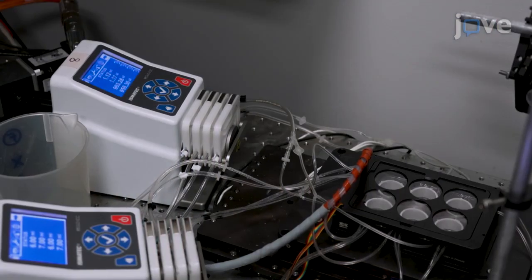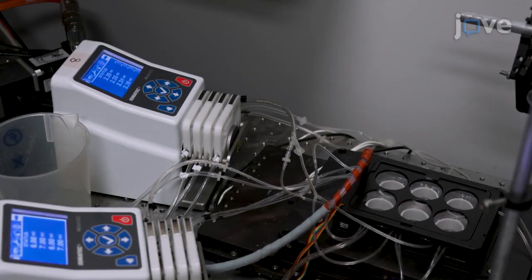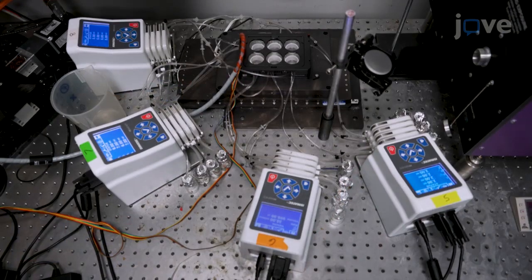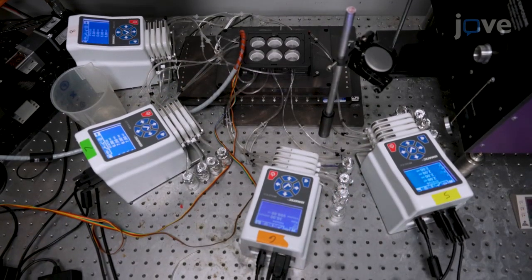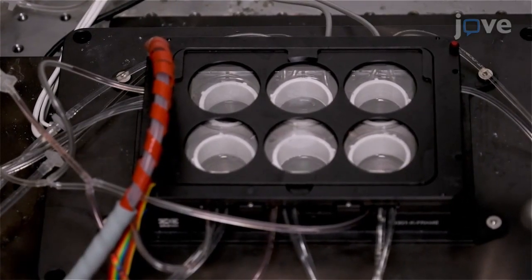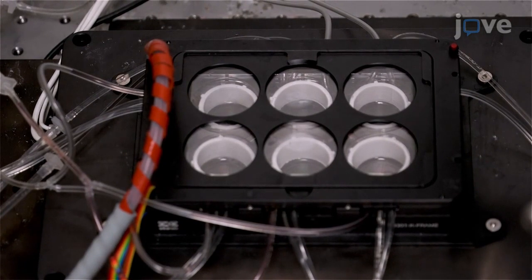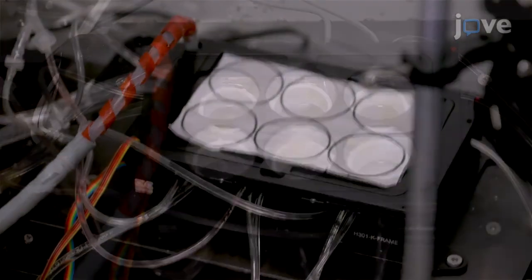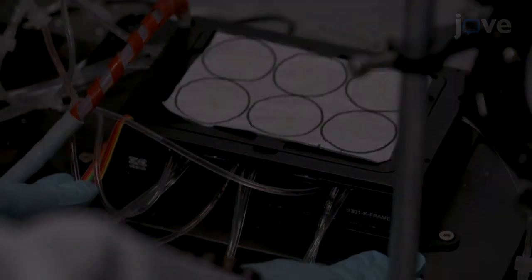Use one peristaltic pump to completely remove cell media from all 6 wells. Prime solvents in each channel of the other 3 peristaltic pumps. Then infuse hydrogen peroxide and quench buffer in their respective alternating tubes until the reagents reach the incubator ports. Confirm that the laser beam has been angled correctly.